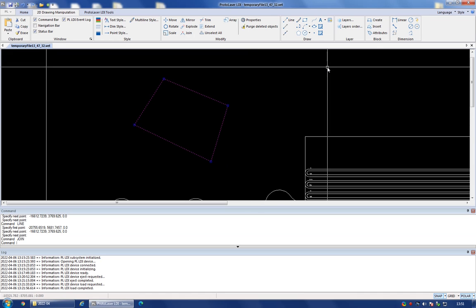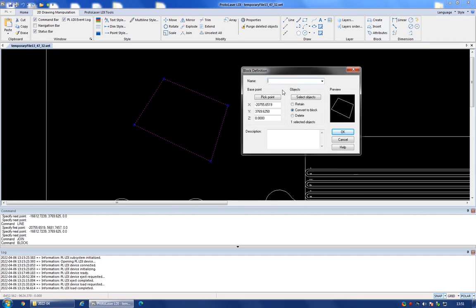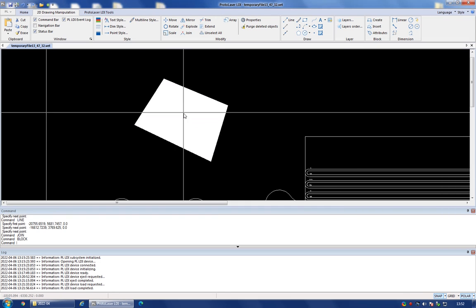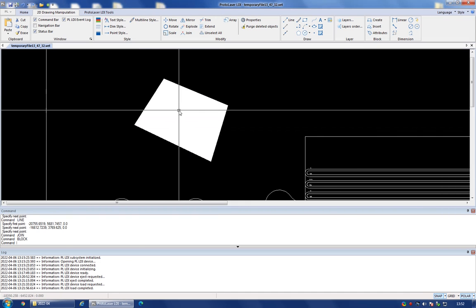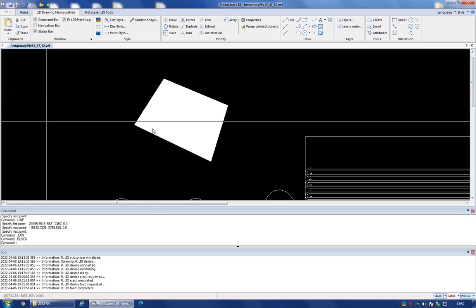So you can go to this block section of commands, and you can hit create block, and now you will come up with this window, which is asking you to input a name for the block. So I'm going to call it, for example, shape underscore 01. I'm going to keep this option ticked, convert to block, and I'm going to ignore everything else. Okay, so if I now hit OK, you will see that the shape that I have drawn before has been converted into a block, and it's now got this solid white filling color.